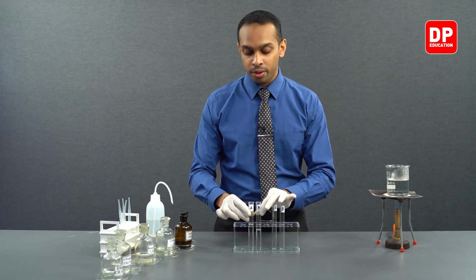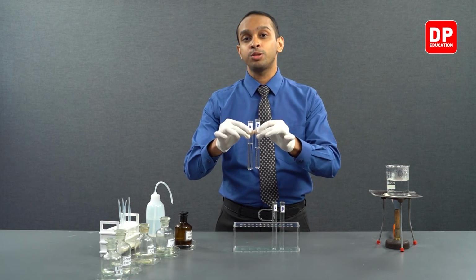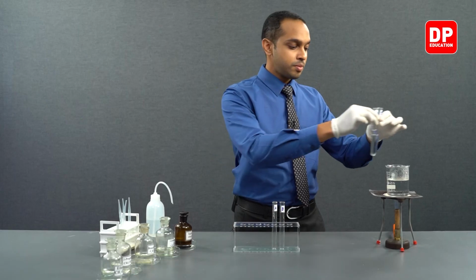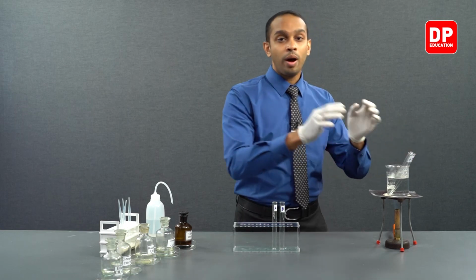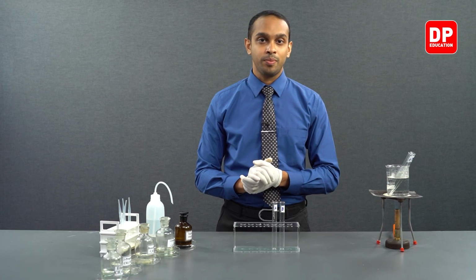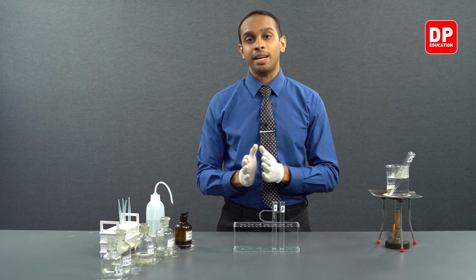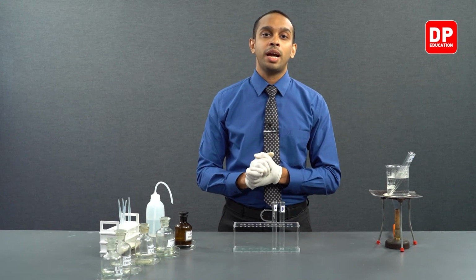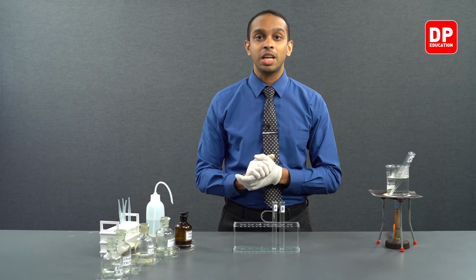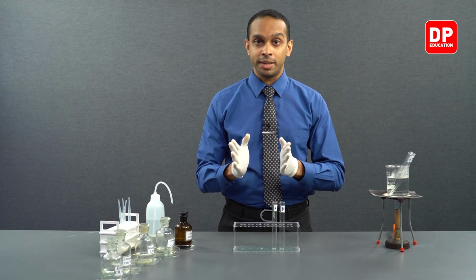Let's place them both in a water bath and leave it there for a while to see if they answer to the Tollens reagent. While they warm up, I will explain to you what happens here. When you add Tollens reagent onto aldehydes, aldehydes get oxidized into carboxylic acids, and Tollens reagent has silver ions that get reduced into silver solid.